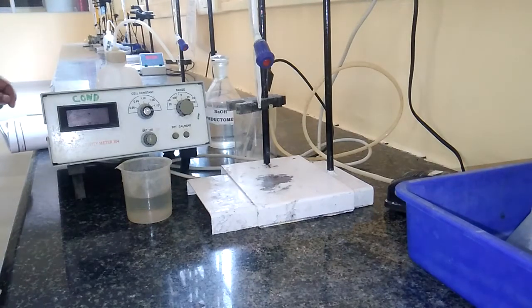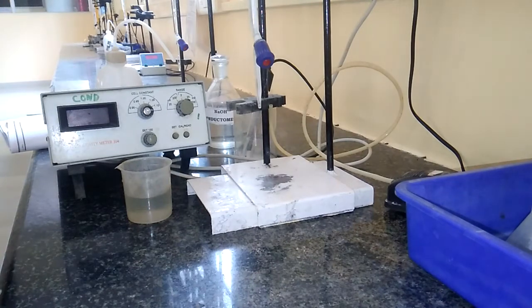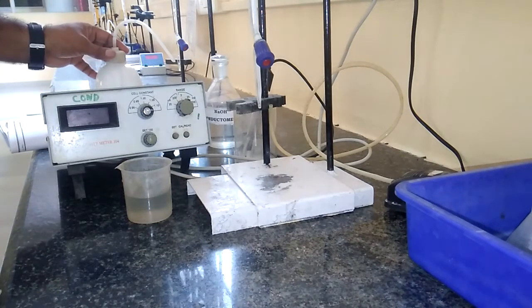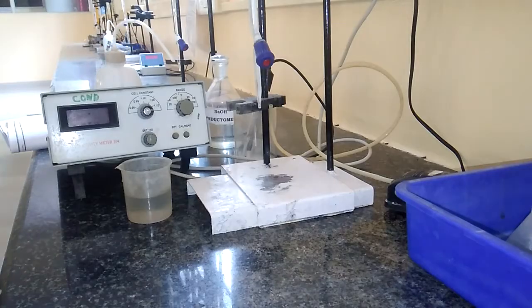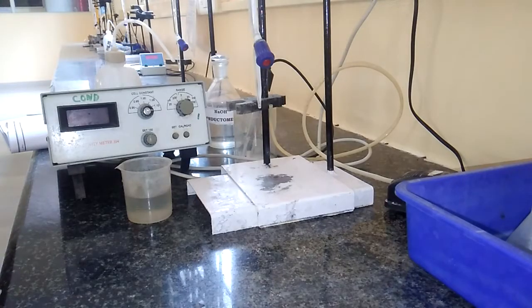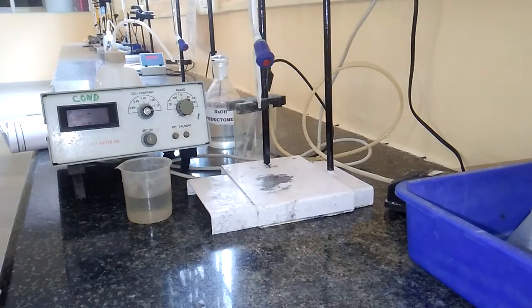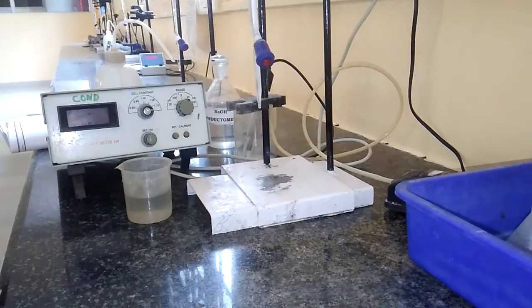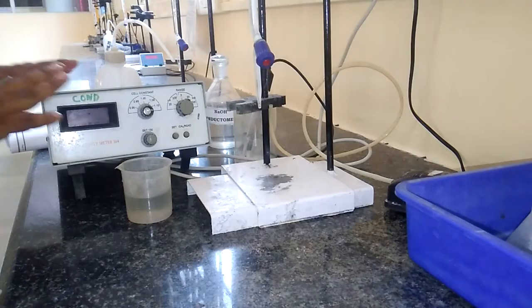Dear students, today I am going to give you the demonstration of conductometric estimation of acid mixture. For this experiment we need some devices, chemicals, glasses etc.